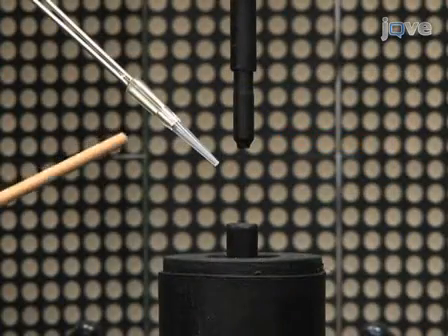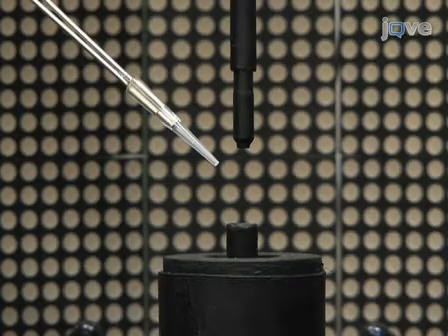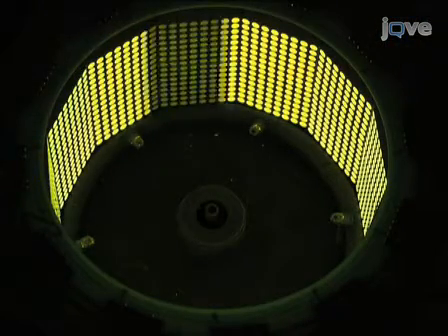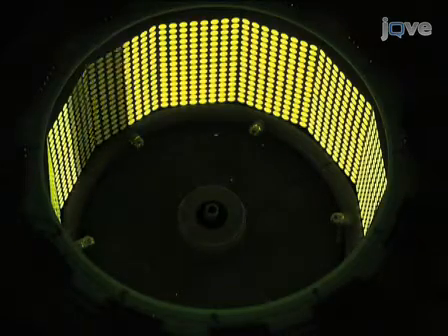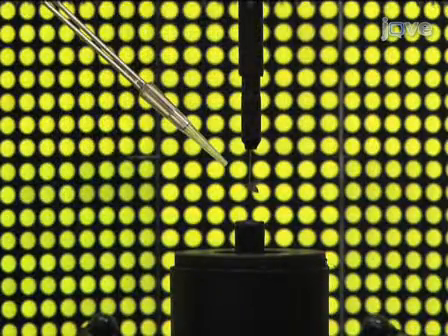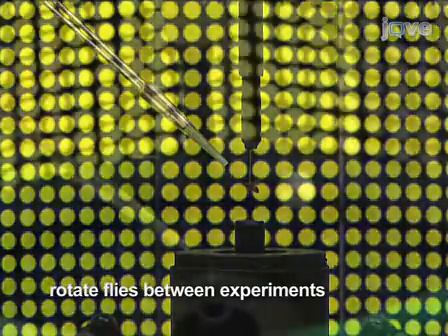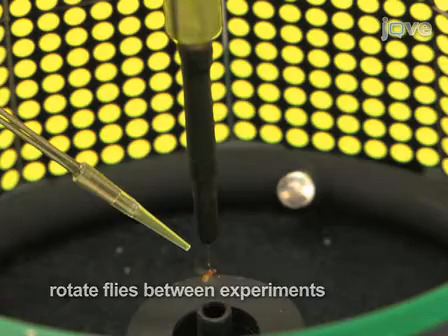When using high odor concentrations, residual odor may be released from the odor port after the odor is switched off. To minimize any effects this may have, spin the fly for a few seconds with a rotating panorama to allow the system to flush out any residual odor. It also helps to visually rotate the fly between experimental treatments. This keeps the flies actively engaged in the experiment and keeps them from remaining in one spot.